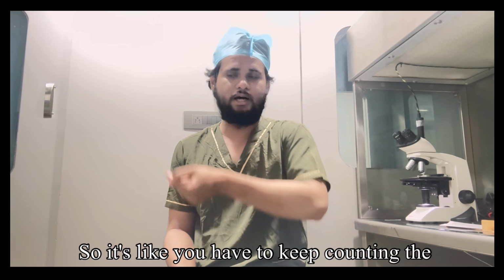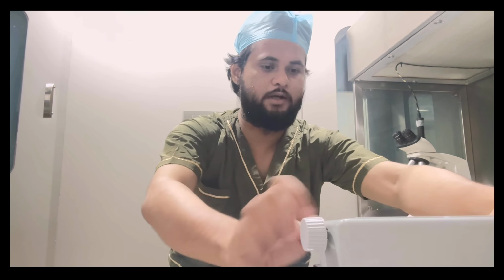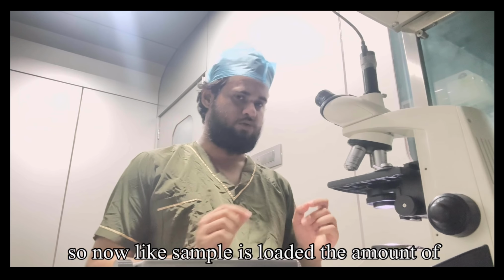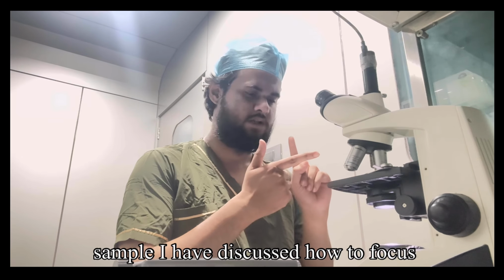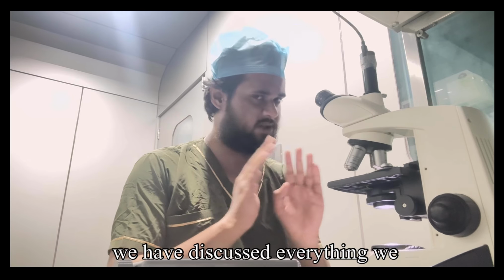So you have to keep counting the grids. How will you count? Okay, wait, I will show you. Now the sample is loaded, the amount of sample I have discussed, how to focus we have discussed, what lens to prefer we have discussed, everything we have discussed.